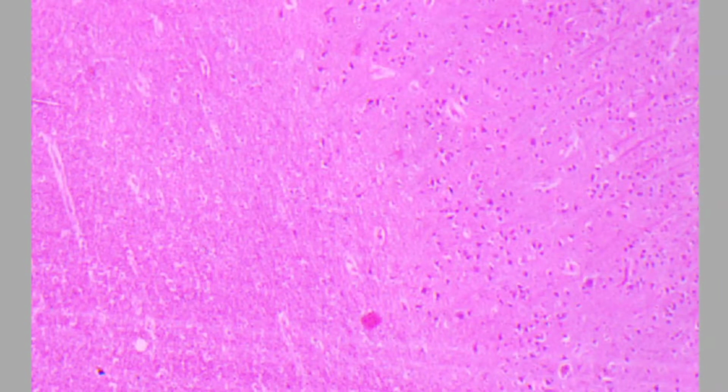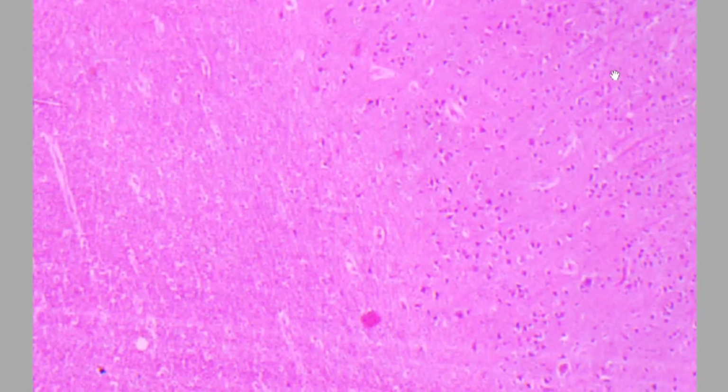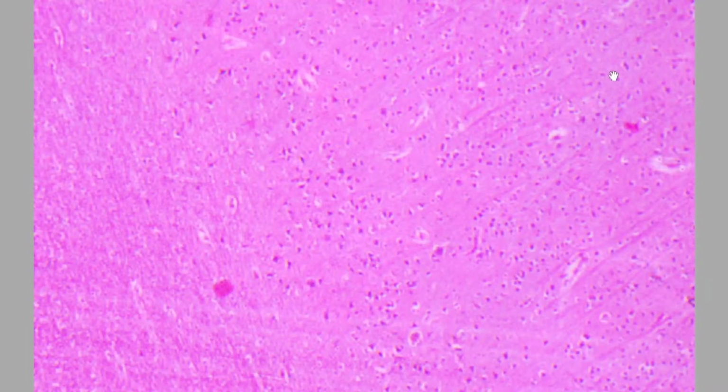Now under 10x you can see these dots are more clear, and if you see that white matter area, you will find that this is the white matter area which I told you. Now this area is there. So now you can very well differentiate. This is the area which is showing the large number of the dots, and this area is not showing the dots. Now you have to concentrate on these areas which are showing the dots. So I am focusing this area, and we are now seeing these dots under the 40x.